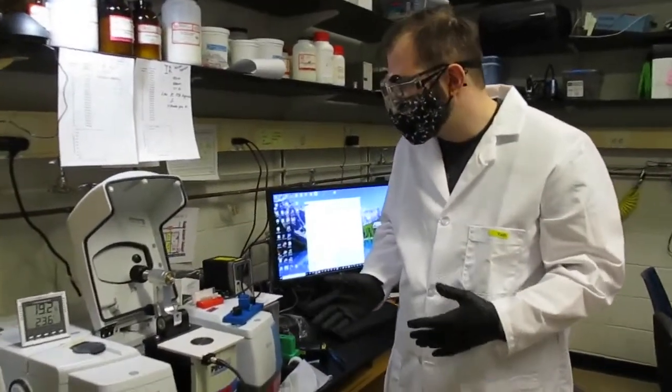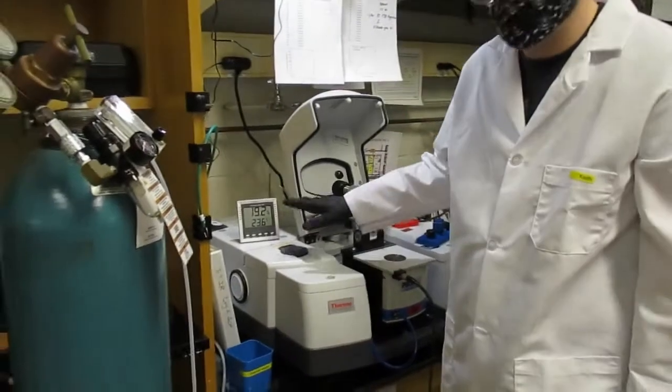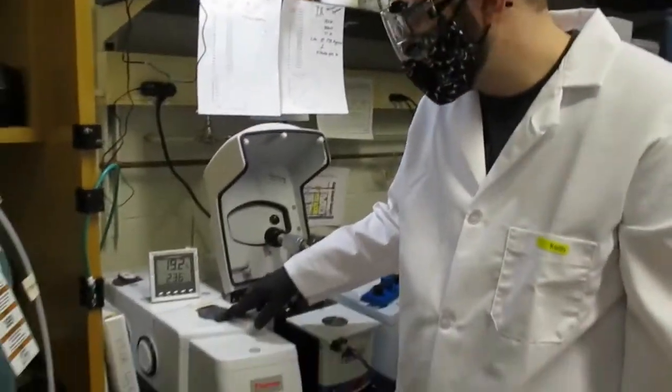So before we run the instrument, the first thing we have to do is fill it with the liquid nitrogen that we got before.